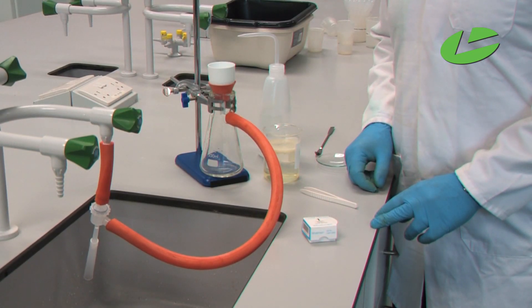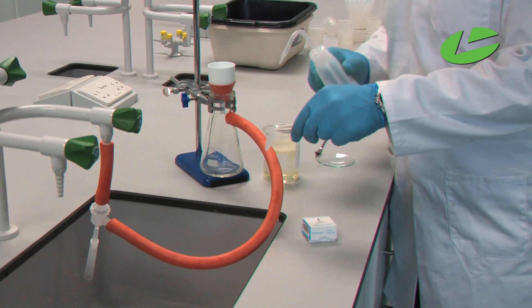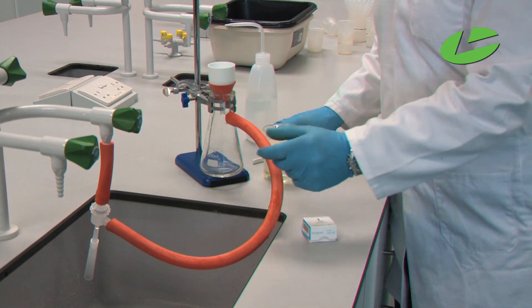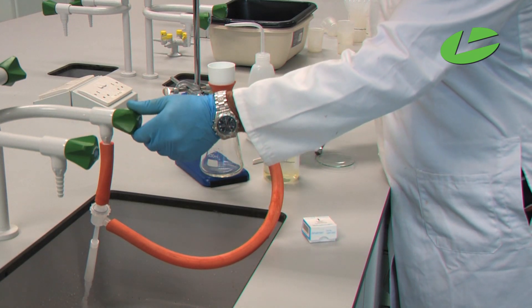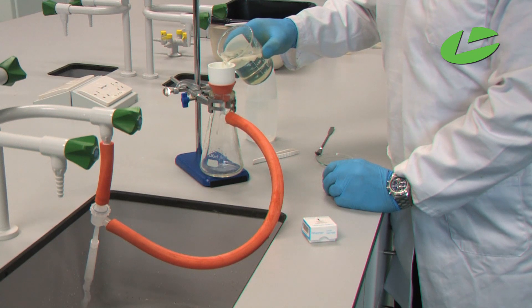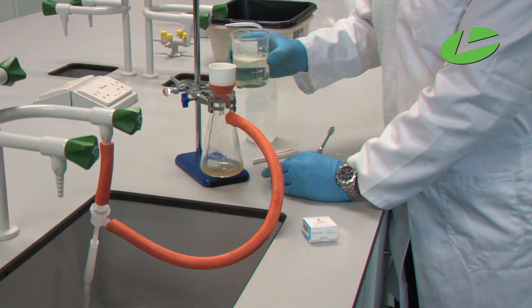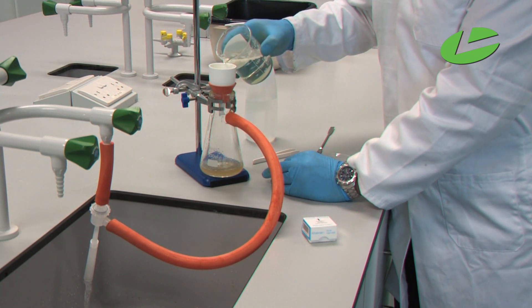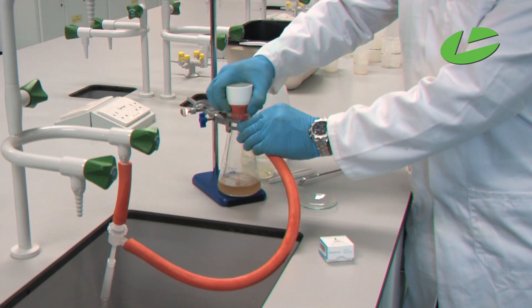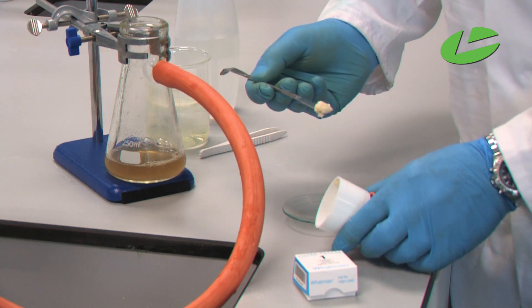Here you can see the Buchner apparatus already set up. I'm going to wet a piece of filter paper with deionized water, then turn on the pump and gently pour the reaction mixture. You can see the unwanted products dissolved in water being drawn through the filter paper, while the soap is caught on the filter paper. Here we can see our soap product collected in the filter paper.